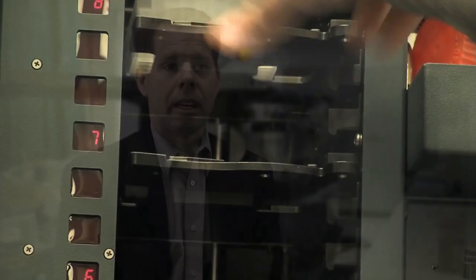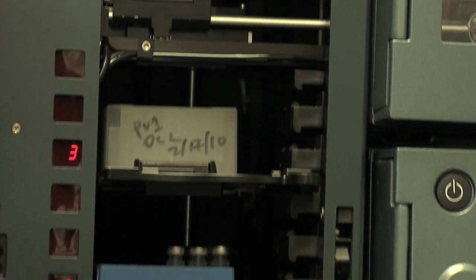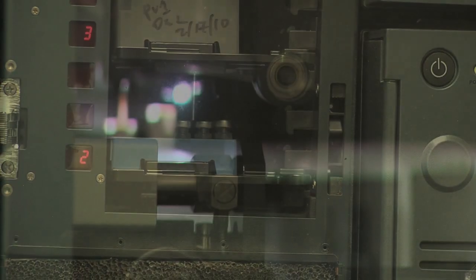With respect to MSE, I can't think of a more powerful way for us to do our metabolite profiling. We're capable of acquiring both low energy and high collision energy spectra at the same time.